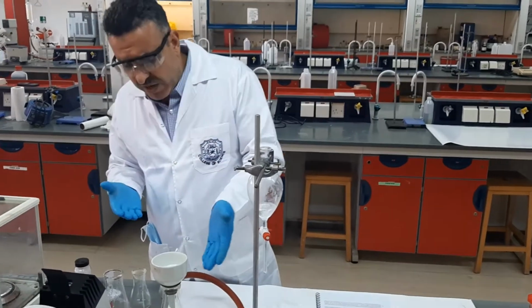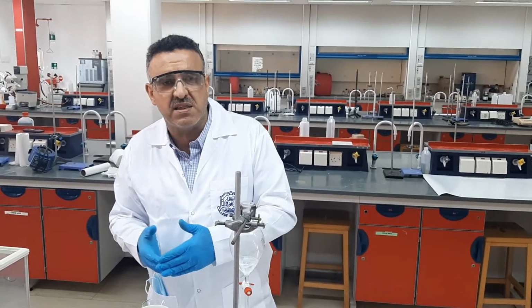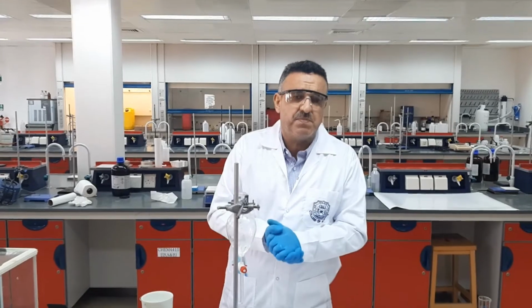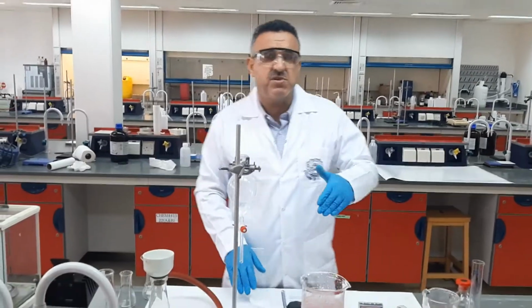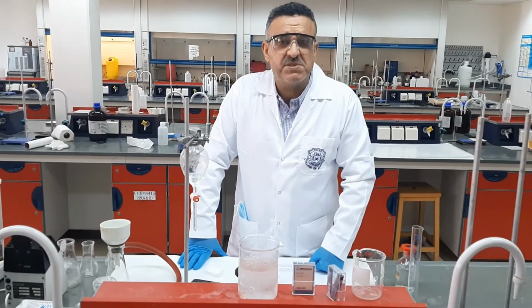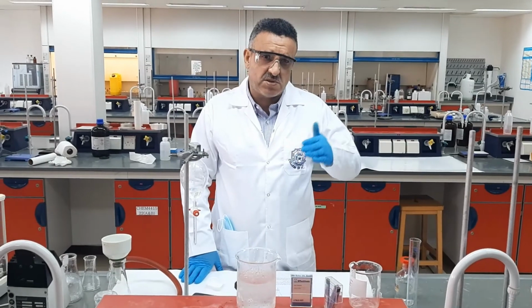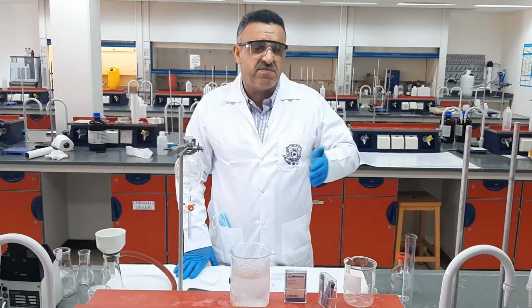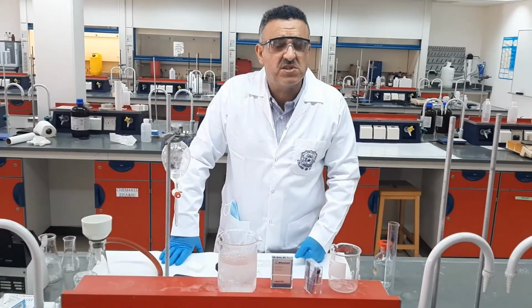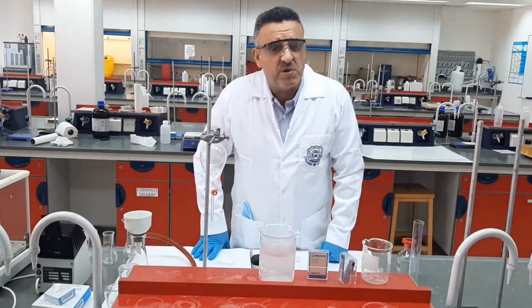Now, we are not sure about the purity of the benzoic acid. In order to purify the separated benzoic acid, based on your procedure, you have to do the recrystallization experiment, following the steps as we did the previous time. And finally, in order to check the identity of the benzoic acid we separated from the mixture, you need to determine the melting point and the melting point range. With that, we are done with this experiment.